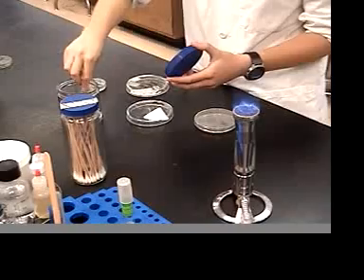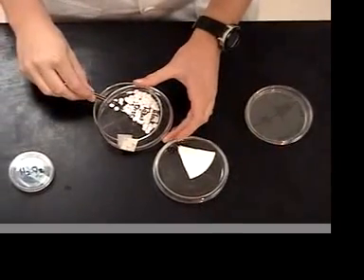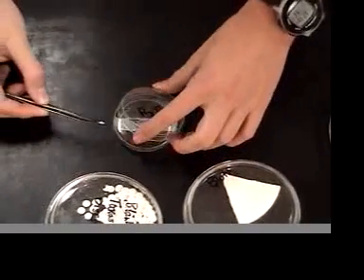Now, in order to test antiseptics, we'll first pick out four different antiseptics, then you'll inoculate sterile discs using whichever antiseptic you've chosen.